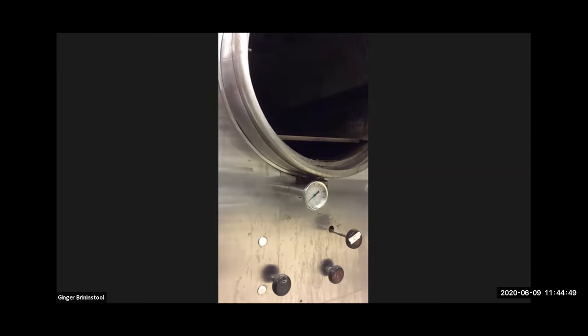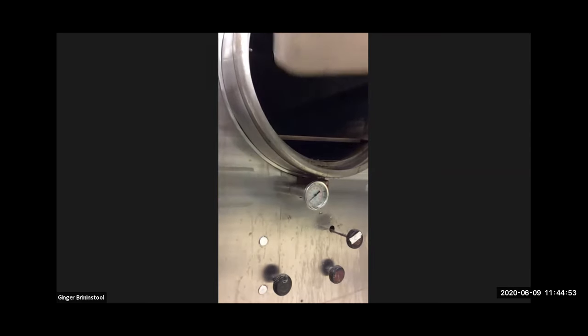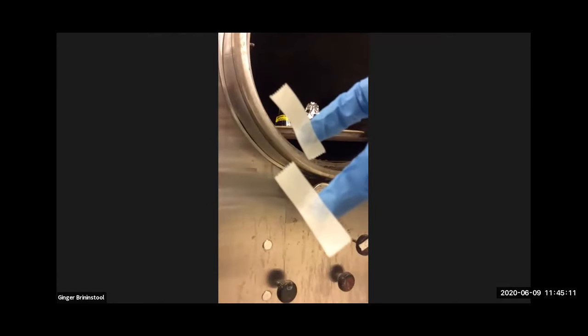So I took those out and just set them on the cart. I'm going to put the next ones in. And to do that, I'm going to put them back on. I just swapped the trays. All right. And so I have a tray. So there's my nutrient broth in there. So that's the media we just made. Before I close the door, I need to add a piece of tape to each.